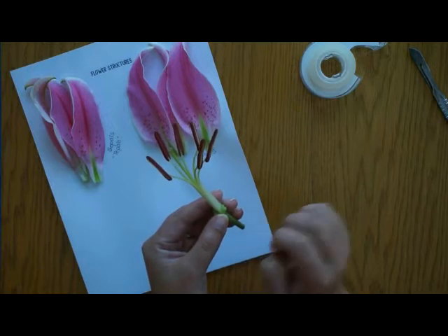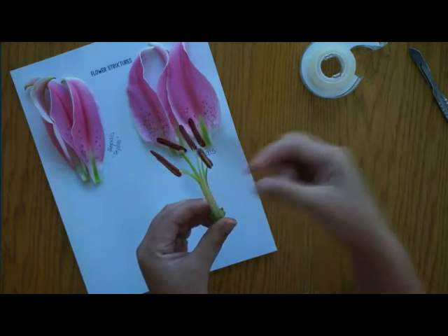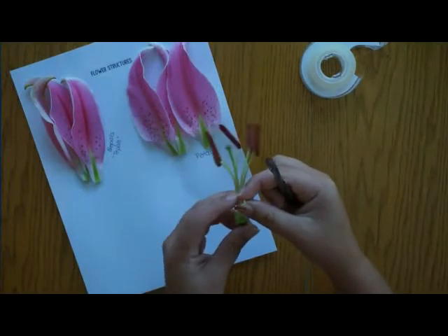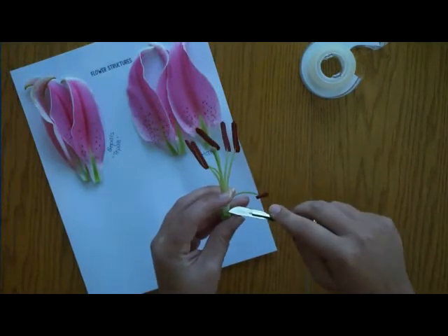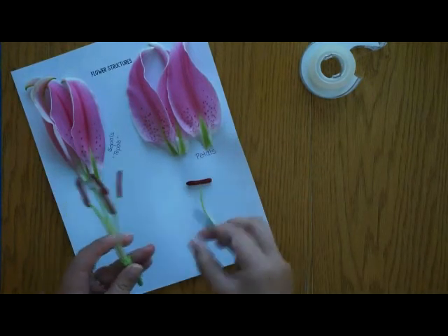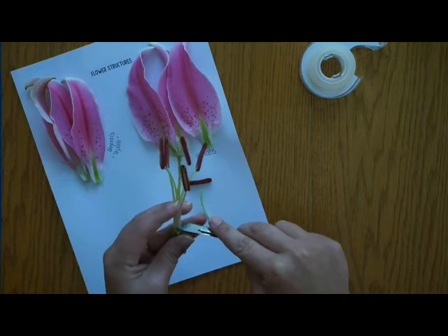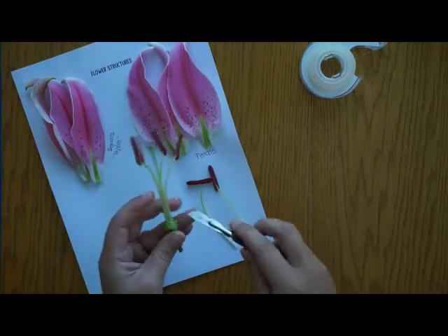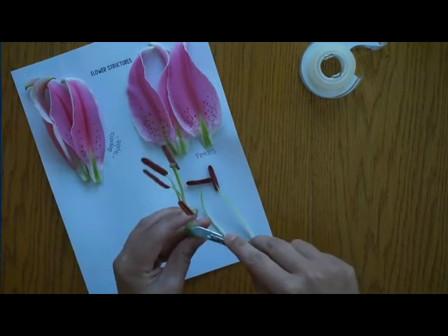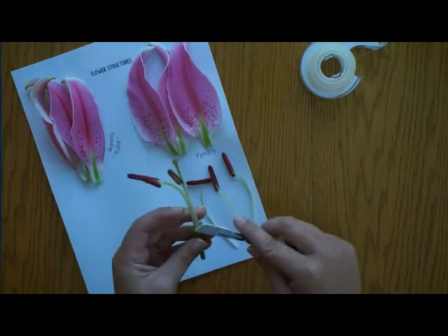Our next step is to take off the stamens of the flower. The stamens are the male part of the flower. They have two sections: a filament, which is the long stalk, and the bulby large part at the top called the anther. Take those off as close to the receptacle as you can, and do that for all of them. Be careful as you're taking them off because you don't want to cut through that center structure — we're going to look at that next. On the lily, the stamens are the brown parts.